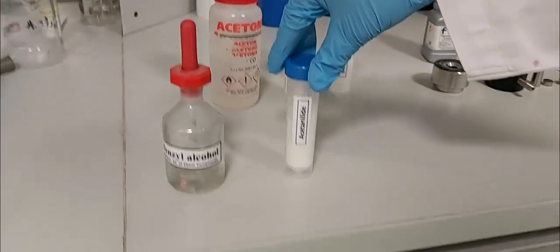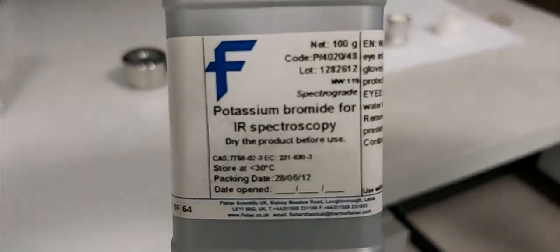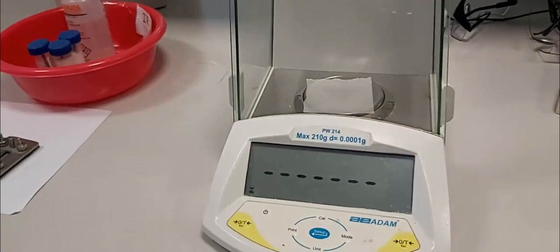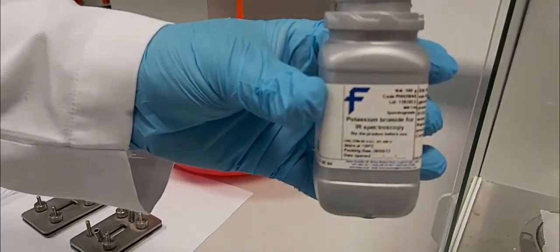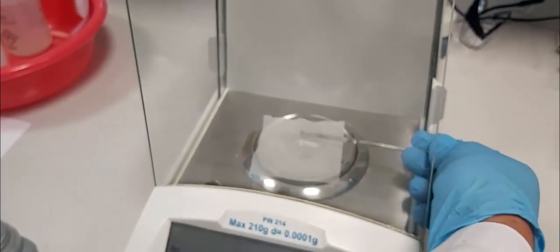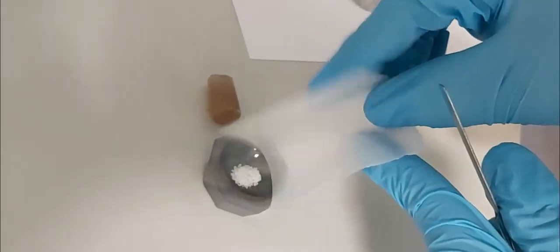First of all, we will prepare the KBr blank — the background. We prepare the blank by using KBr alone. We weigh around 200 milligrams of KBr using the analytical balance. Here we have 200 milligrams — 201, practically the same.